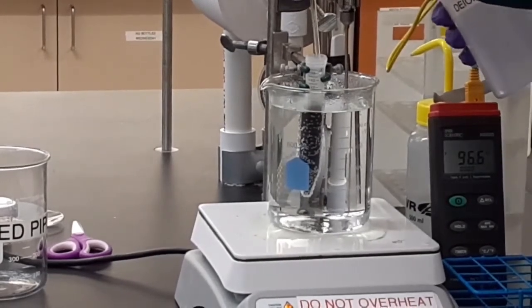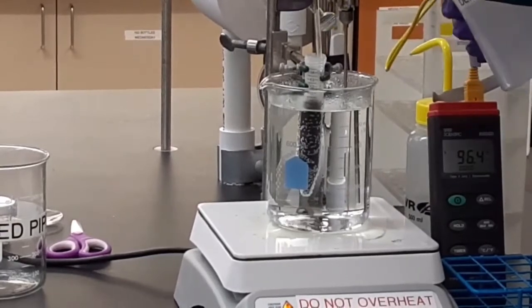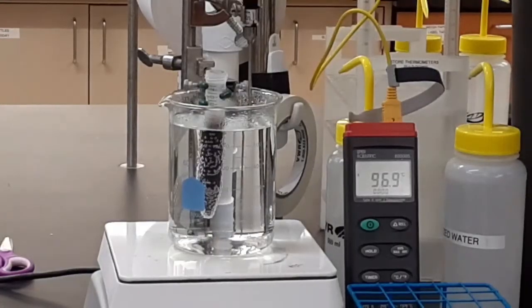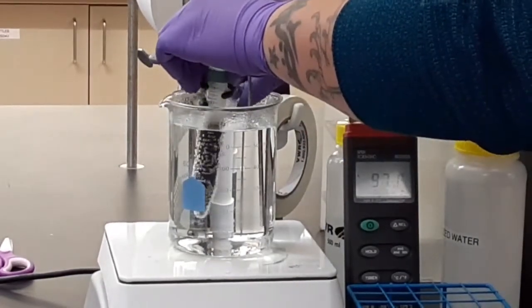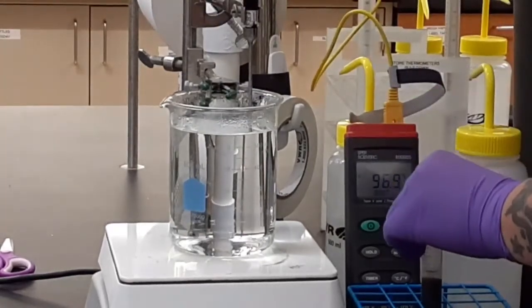Now, anytime you remove your stir rod from your sample, make sure you rinse it down thoroughly with more DI water, because if you don't, you're going to lose product. So now we're all done. We're sure our product is reacted thoroughly. We remove it from the hot water bath and proceed to the next step.